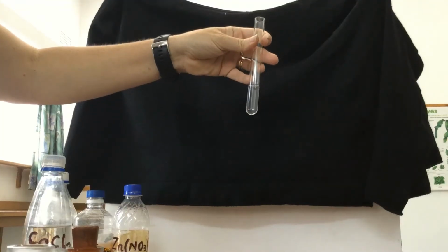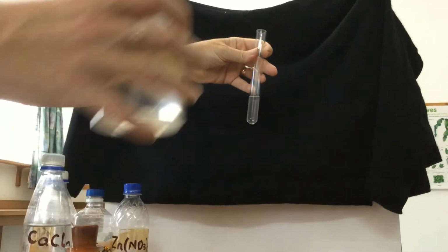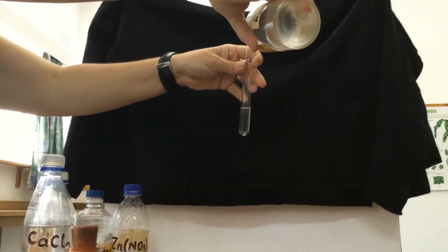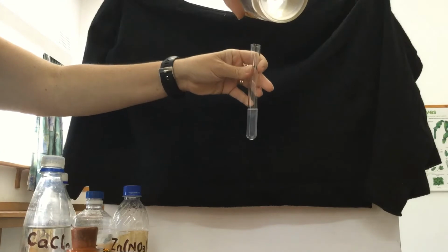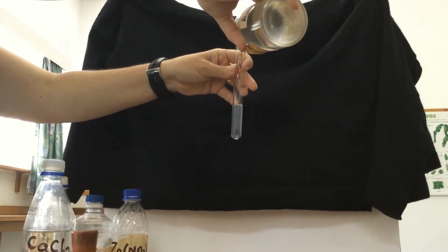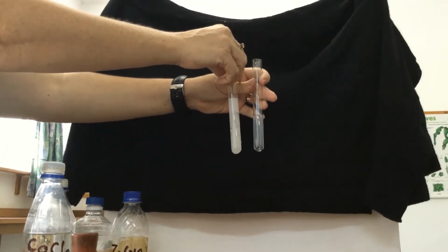The ammonium hydroxide, we're expecting to see either no precipitate or a very slight white precipitate. So I've made a black background here so that we can look really carefully, and I'm hoping you can see that there's a very slight white precipitate that forms with ammonium hydroxide. So those are the tests for calcium cations.